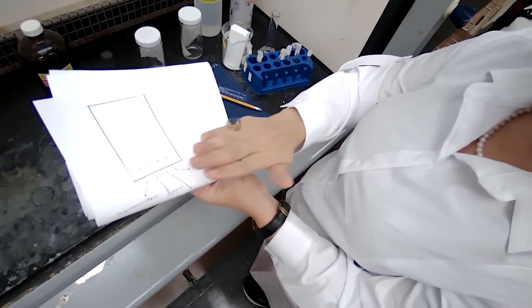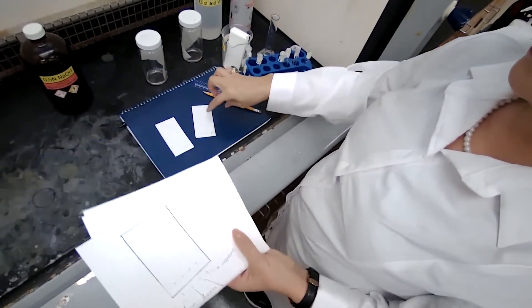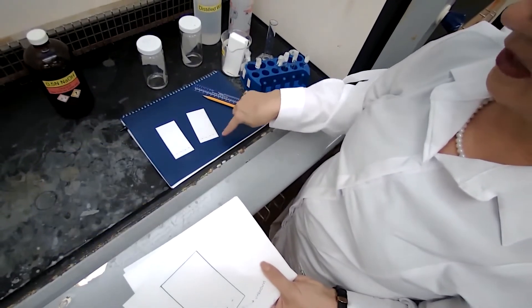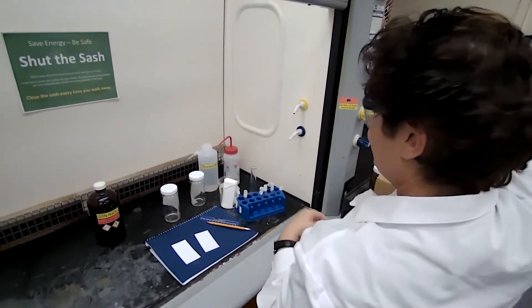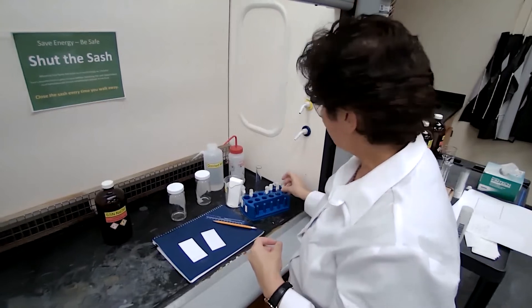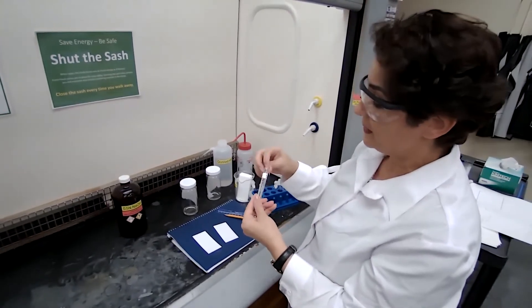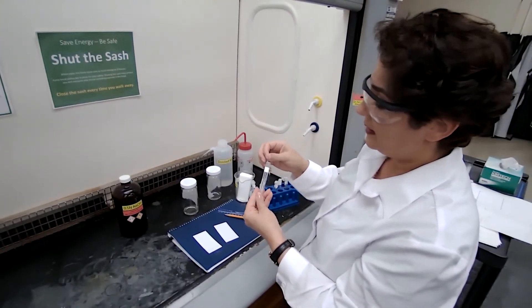So I'm keeping the exact same pattern on my TLC plate because I cannot draw it on the plate. When we are spotting, the size of the spot matters. We don't want large spots because then they will get mixed.